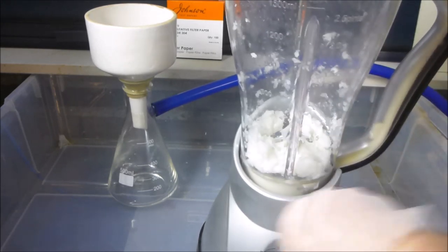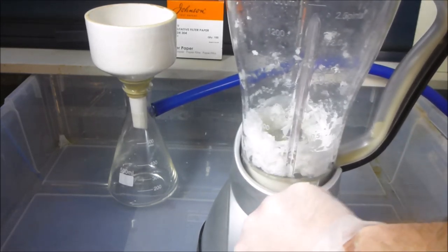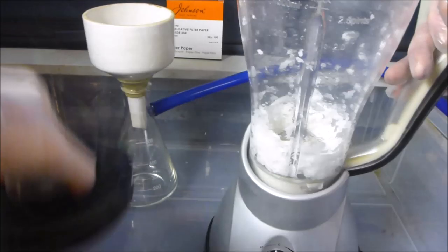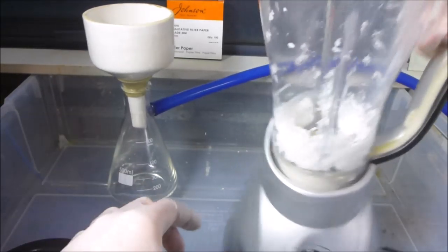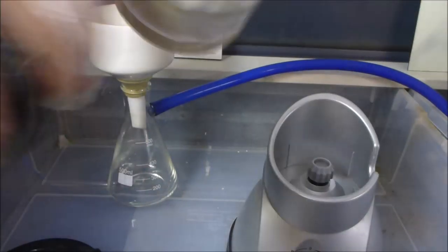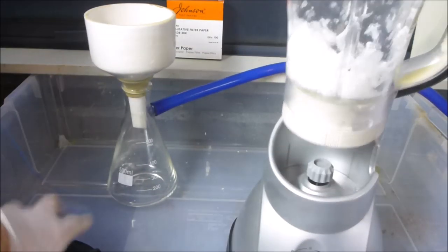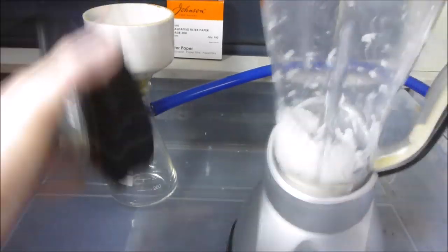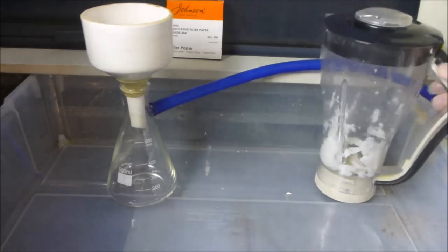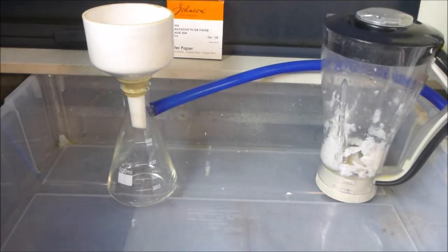It's a bit annoying, but I think we're going to have to live with that as is. So the idea is to turn your paper into a bit more of a mushy substance. Okay, now that that's relatively chopped up, let's move that out of the way a little bit.